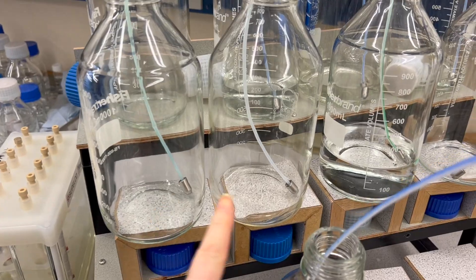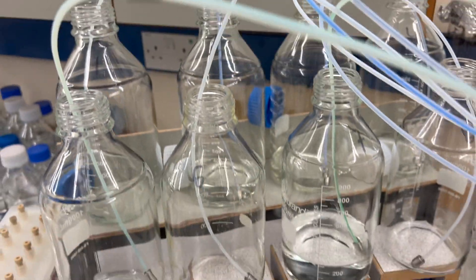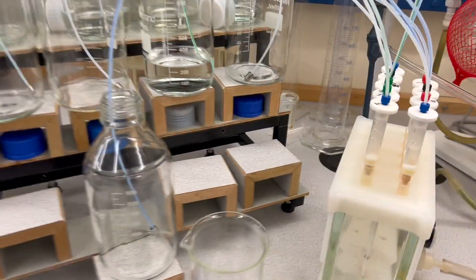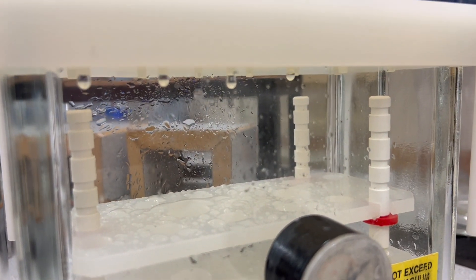I've been working on my grant in the meantime on the computer. I also had lunch and I had an extended lunch because I went home for lunch and I tried to go to the pharmacy — yeah, a whole debacle. But let me show you the progress on the bottles. That has been almost two and a half hours. Some of them are empty as you can see, but some of them are still quite full. So we just need to keep waiting for them to load at one drop per second.